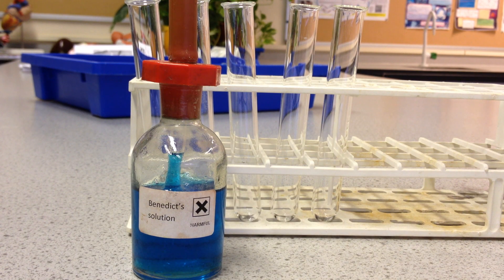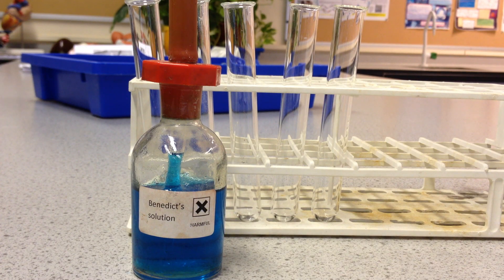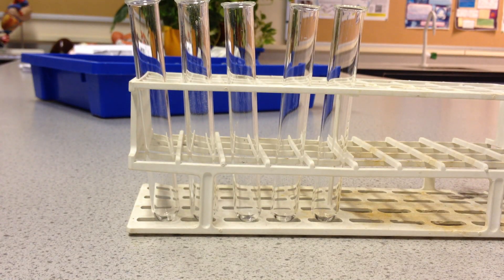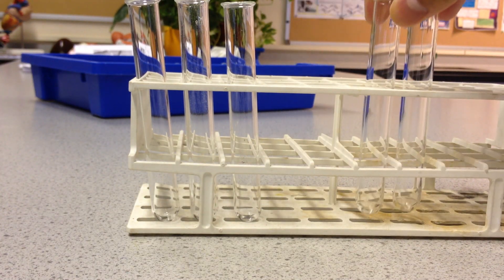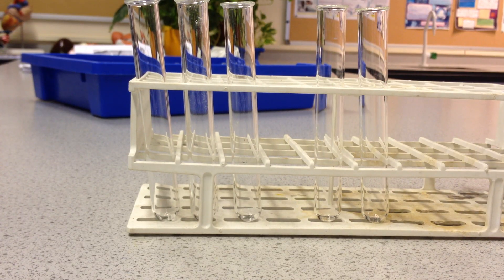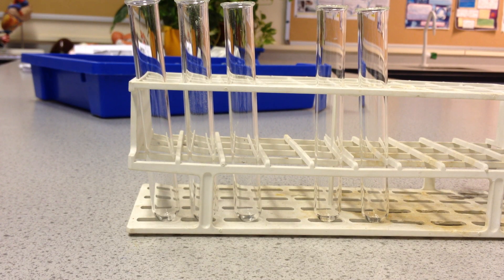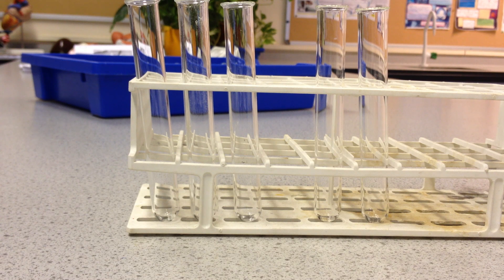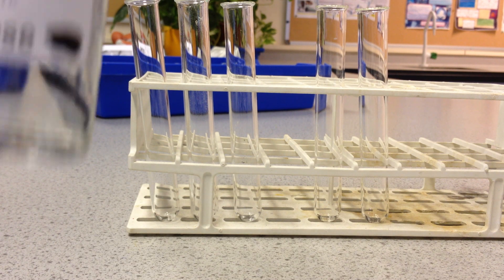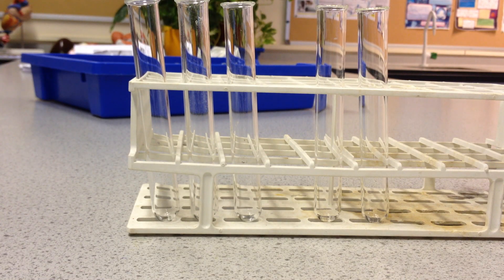We are going to talk about the Benedict's test to test for reducing sugars. Let's start with how we do the test for the reducing sugar itself. So if we start off with two tubes, in one I will add some glucose, which is a reducing sugar.